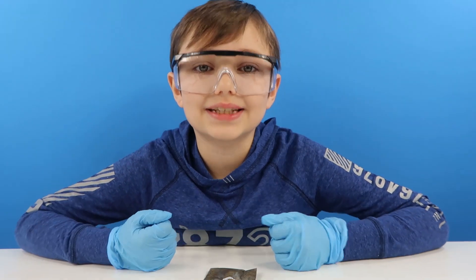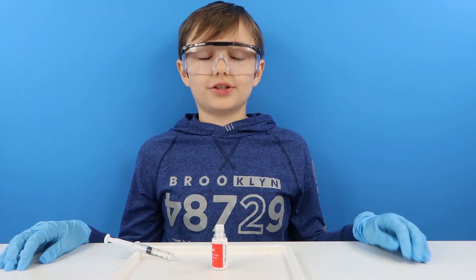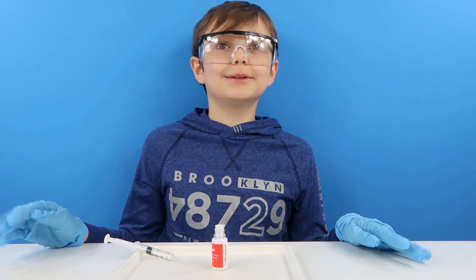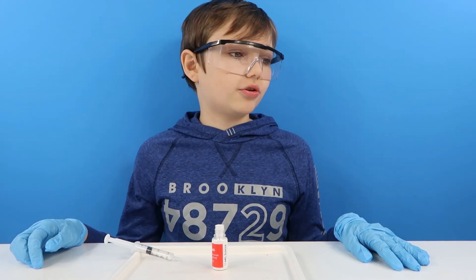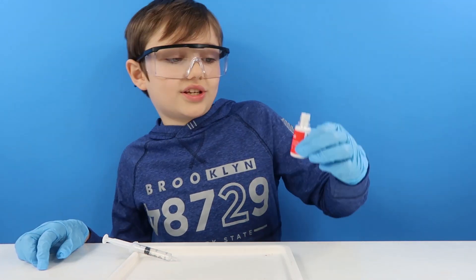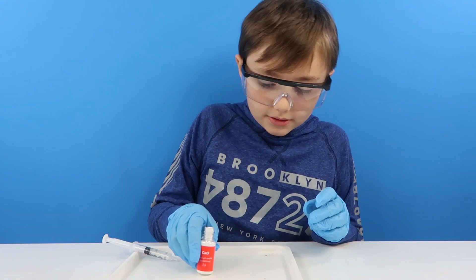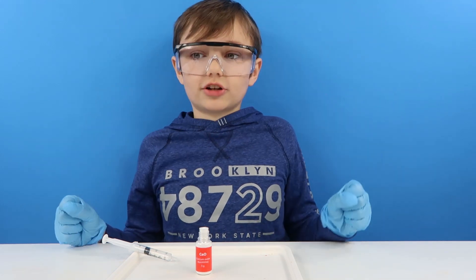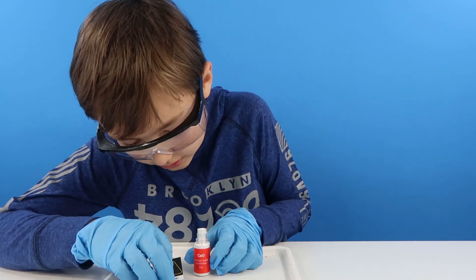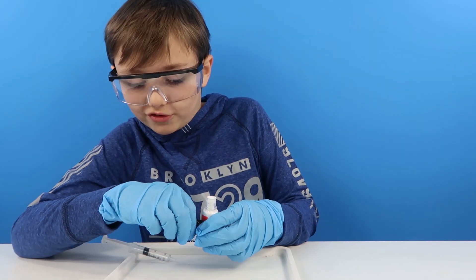Let's move on to the next experiment. So guys, this is just a nice quick and easy experiment that you can do at any time of the day. What we need to do is stick a thermosticker on here — this is calcium oxide, quicklime — and we need to place it at the center of our tray, and then we need a thermosticker. I'm just going to pop it over the name.